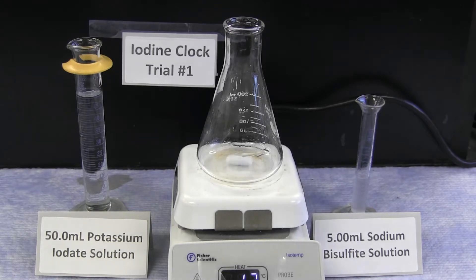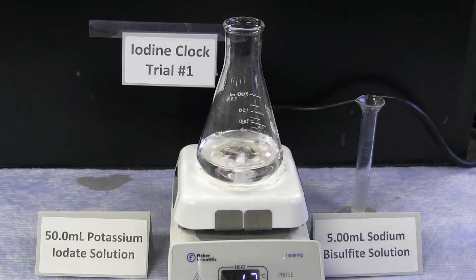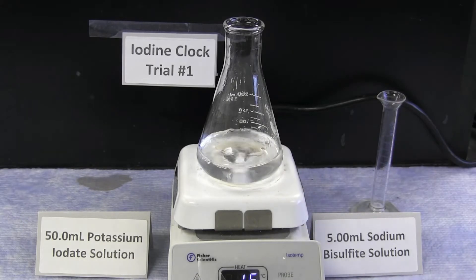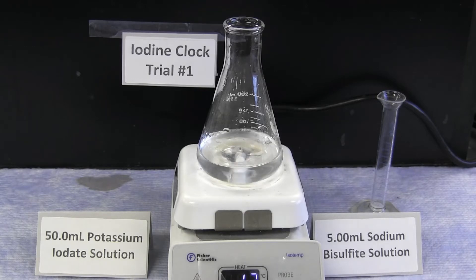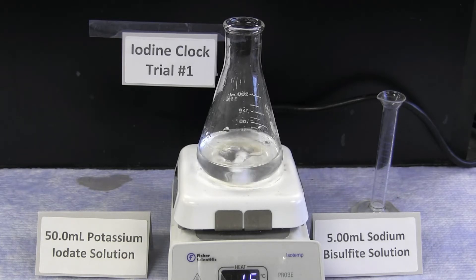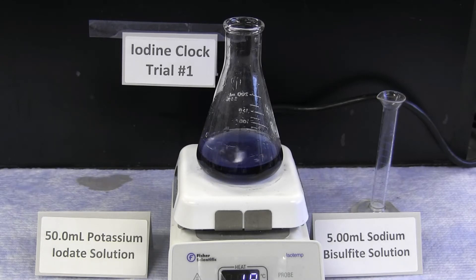In the first trial, 50 milliliters of the potassium iodate solution is combined with 5 milliliters of the sodium bisulfite solution. You can record the reaction time based on when the two reactants were mixed and record how long it takes for the reaction product to appear. The presence of the blue iodine color indicates the reaction is complete.